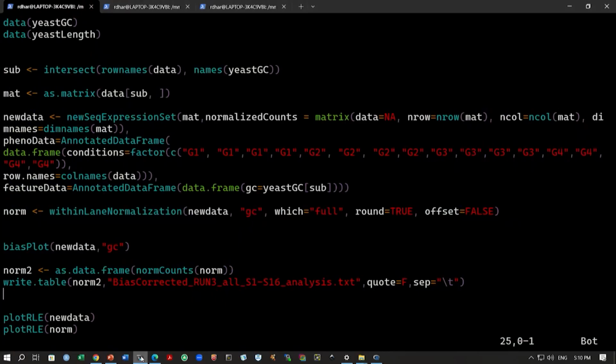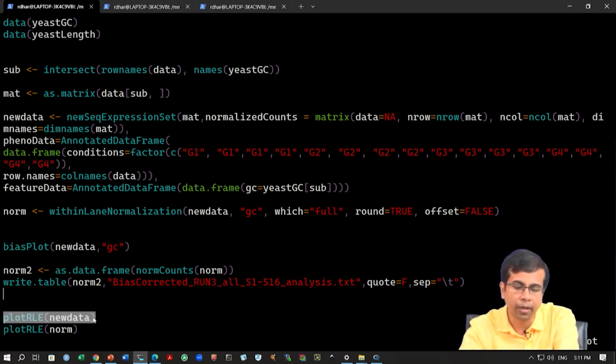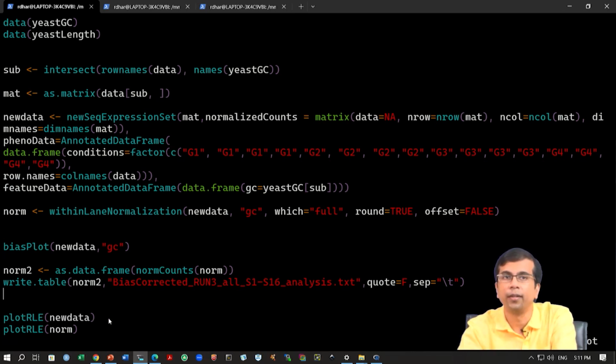Before I look at that file, I just wanted to say that we can also look at this within the normalization, whether this normalization has happened, what kind of adjustment has happened, using the RLE plot. We have used this command before, and here also, within the package EDASeq, we have this plotRLE command. We can look at the data before normalization, which is the new data, and also look at the normalized data, which is the norm variable. So, we can use plotRLE on new data and plotRLE on norm, and we can see very quickly how this normalization changes the data.